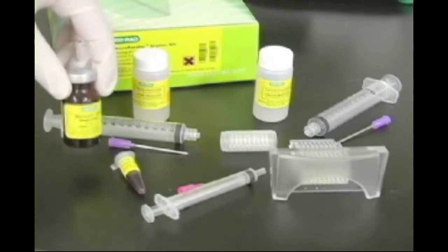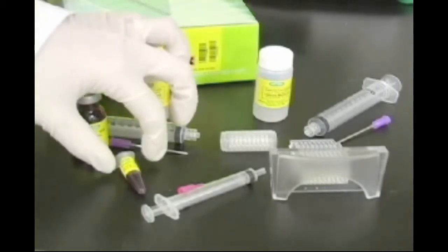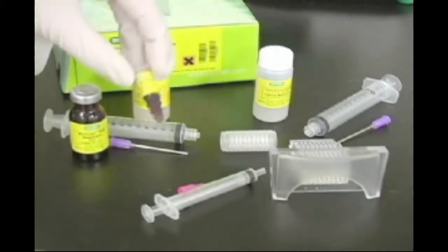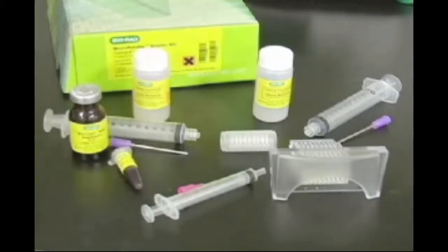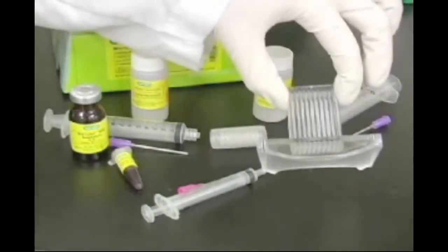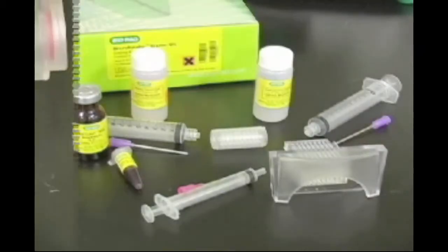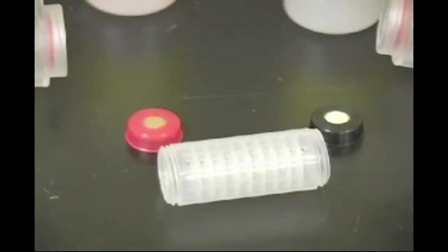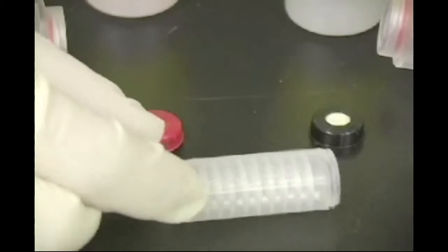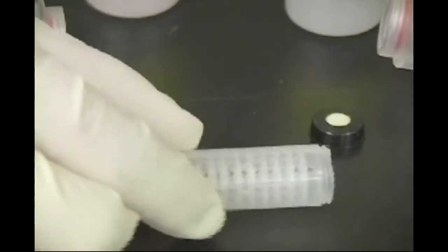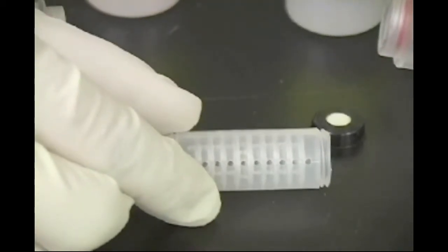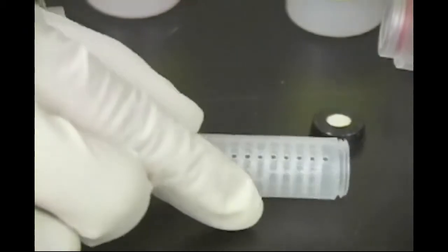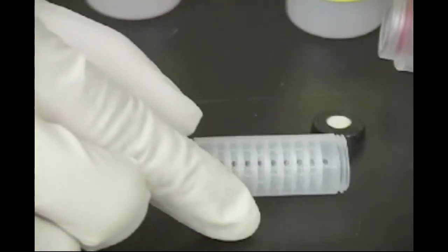Let's take a closer look at the components of the focusing assembly. Two sets of 10 holes or ports are bored into opposite sides of the focusing chamber and are used for sample loading and harvesting. During the run, both sets of ports are sealed with sealing tape.